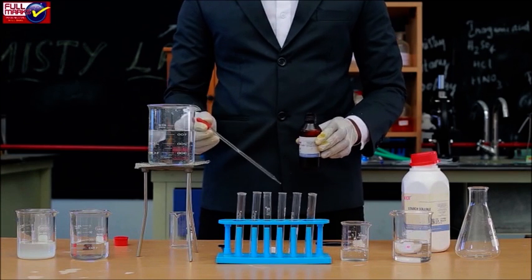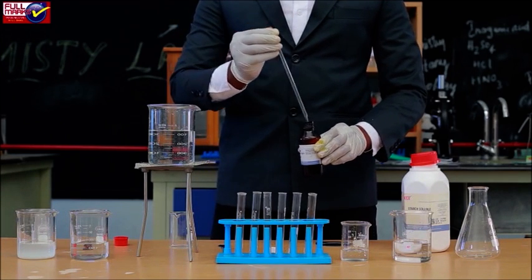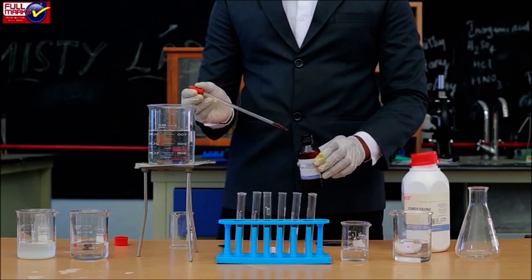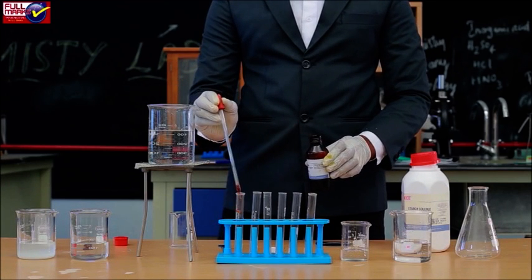Prepare 2 sets of iodine tubes with 6 test tubes in each set containing 1 ml of iodine solution in each of them in separate stands.